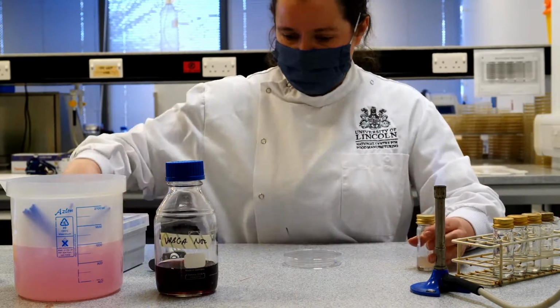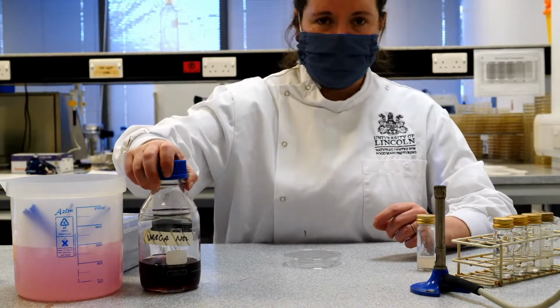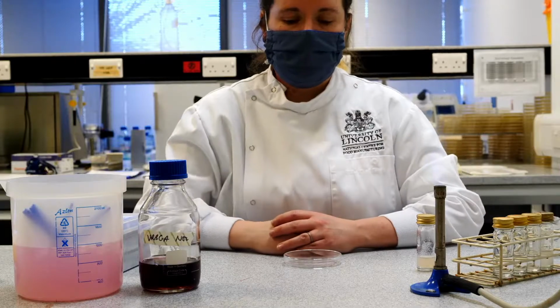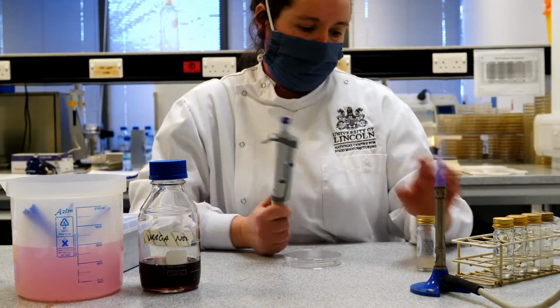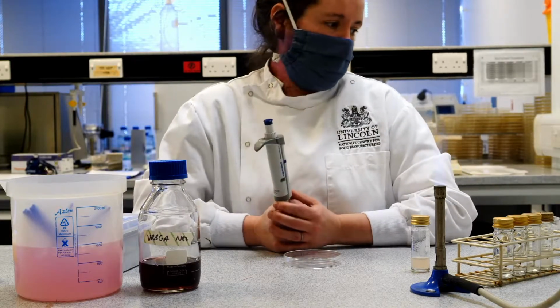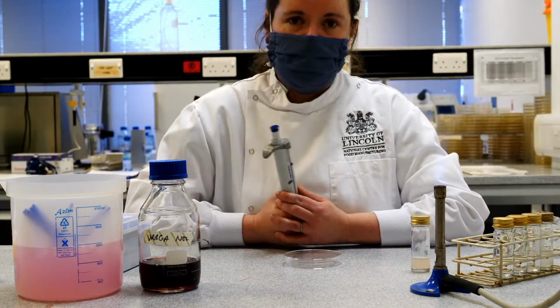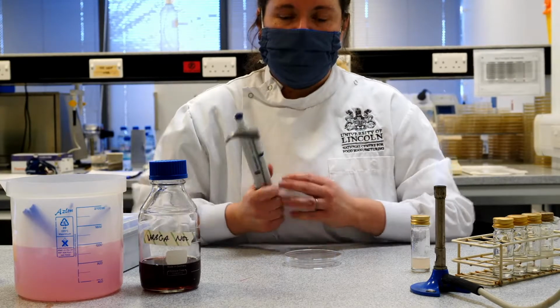Now this time, because we're using a pour plate and we're mixing our sample in with the agar itself, we can actually put more inoculum in there. We can use a whole milliliter of our dilution series this time. And that's really helpful because it allows us to count the number of microorganisms in a larger volume of liquid, which means we're more likely to be able to detect them.